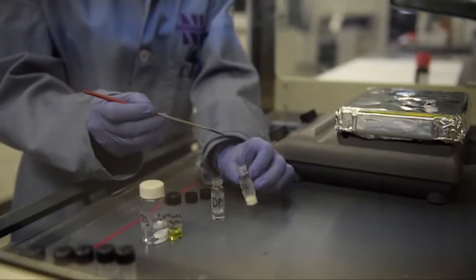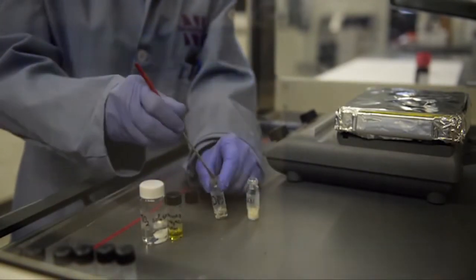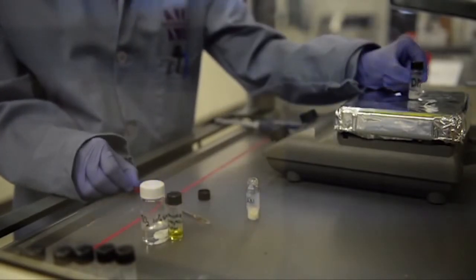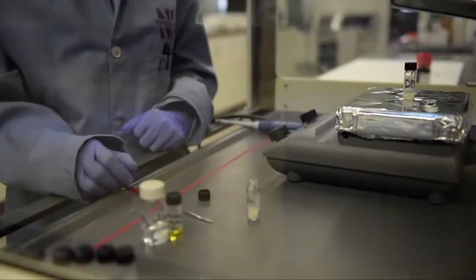Lastly, we will make 0.05 molar copper thiocyanate solution by stirring 6 mg of copper thiocyanate powder in 1 ml of dipropyl sulfide solvent at room temperature overnight. The final solution should look colorless and transparent.